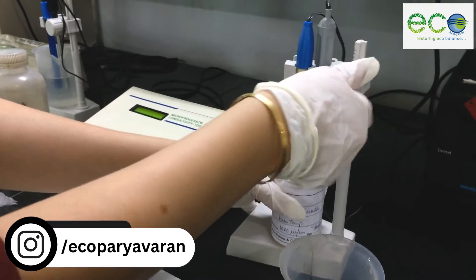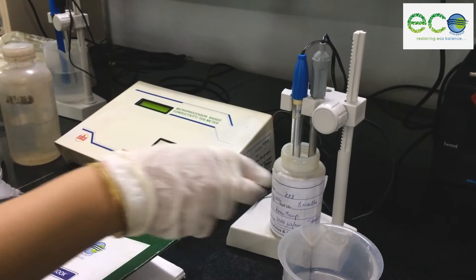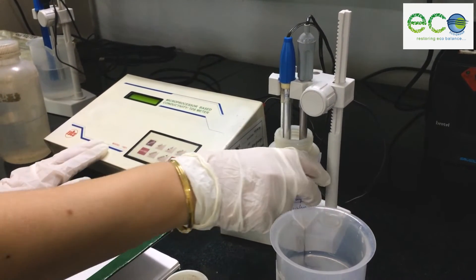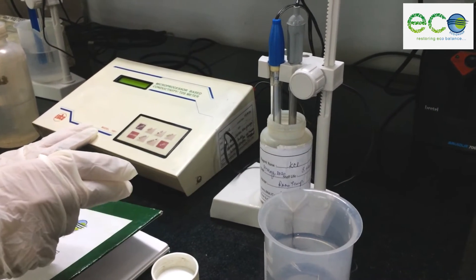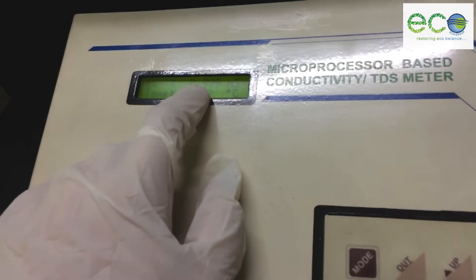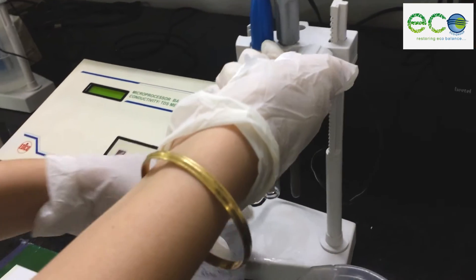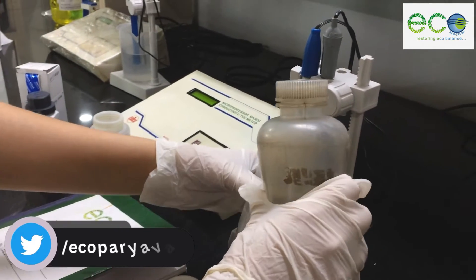The meter is now giving 999 microsiemen per centimeter — it has been calibrated. We will now wipe the electrodes.